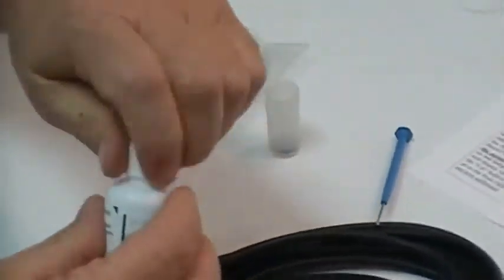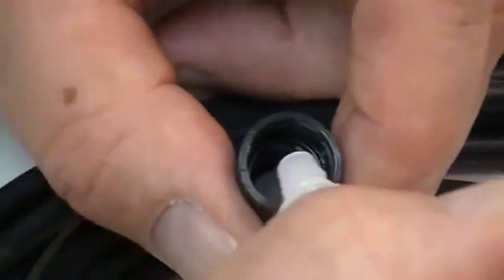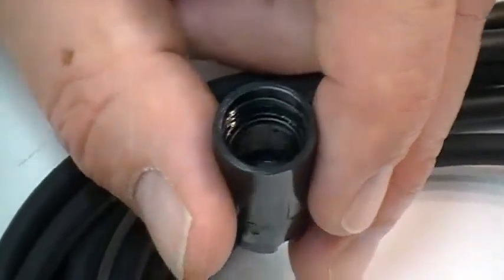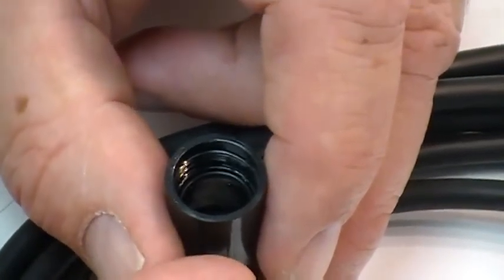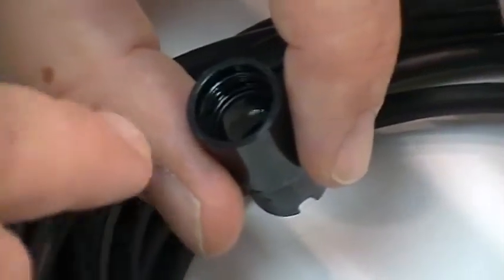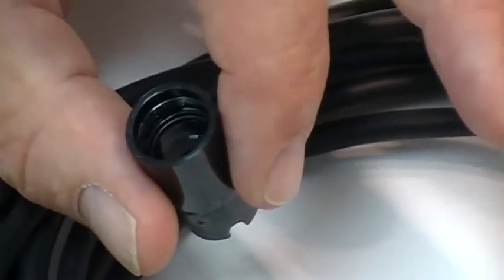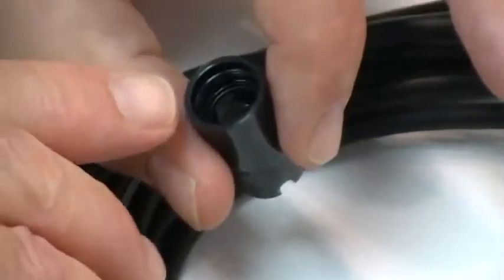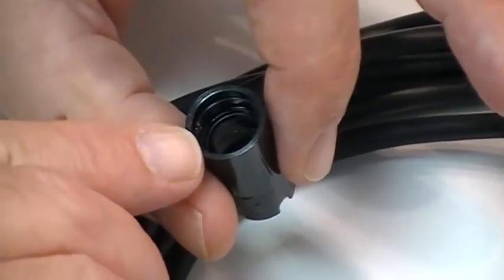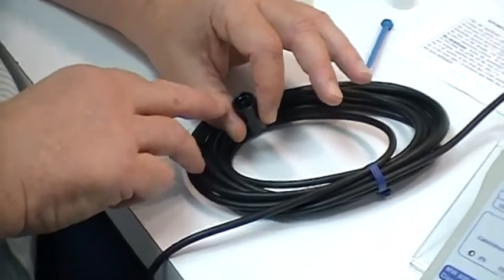You want to take your electrolyte solution and very gently, do not squirt, but very gently load your membrane up to the O-ring that you just put in. When you've got the electrolyte just short of the O-ring in your membrane, you want to look down through the membrane onto a white surface and look for any air bubbles that are inside the liquid electrolyte. This is where any calibration procedure will fall apart because it must not have any air bubbles inside this membrane before it's installed onto the end of your probe.